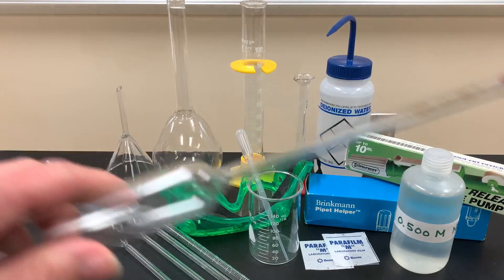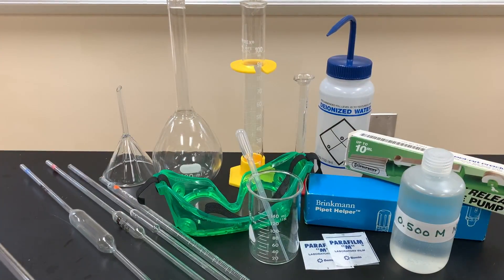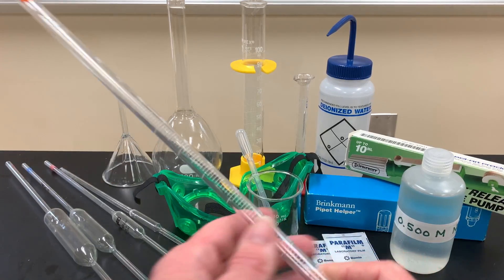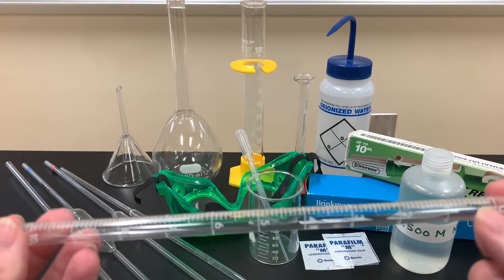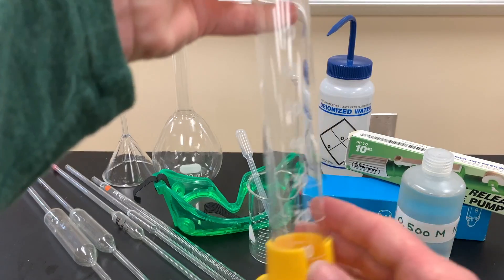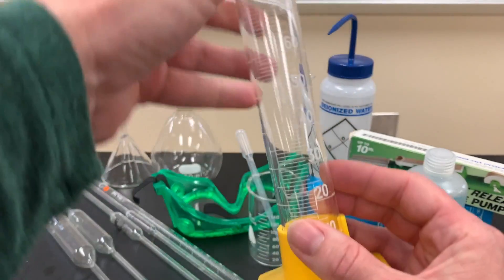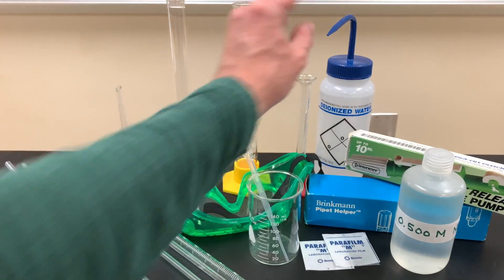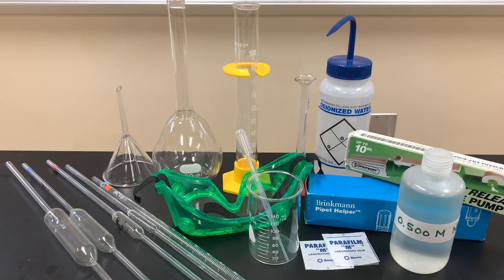If you have volumetric pipettes, use them — a 50 mL volumetric pipette used twice would accurately measure 100 mL. There are also 25, 10, and 5 mL versions, and graduated pipettes marked every 0.1 mL. However, in every lab there should be graduated cylinders, which is what I'll use here. The 100 mL graduated cylinder is marked every 1 mL, so it's less accurate, but it's the most common equipment available. The 50 mL volumetric pipette would be the best option if you have it.